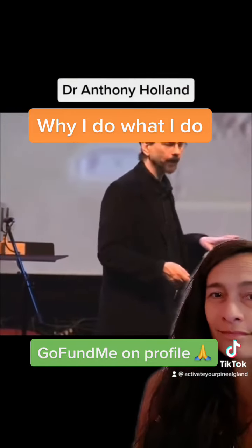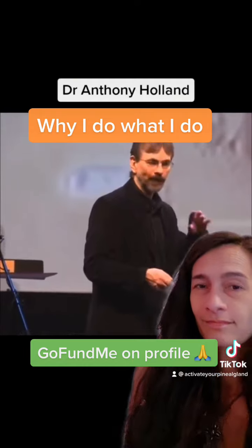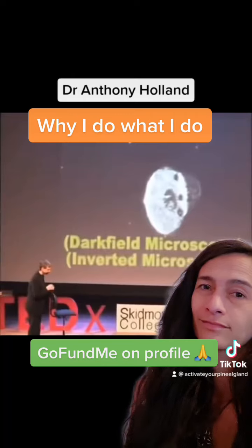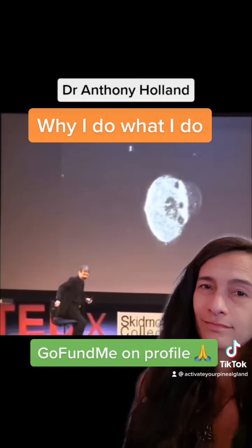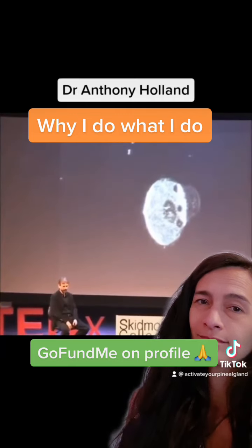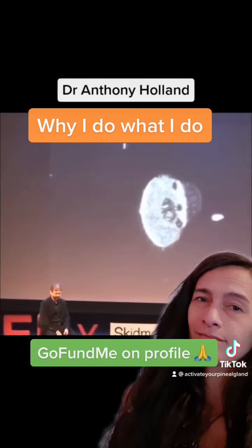If we're lucky, we'll also hear the audio as I narrate the experiment live in a noisy lab. Perhaps you can see the sort of fireworks effect happening from the growing blister to the right of the organism. And here comes a little neighbor wondering what's going on.